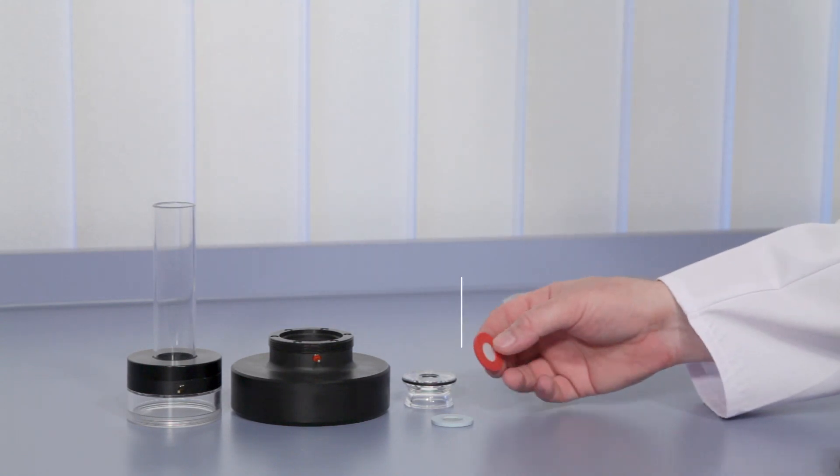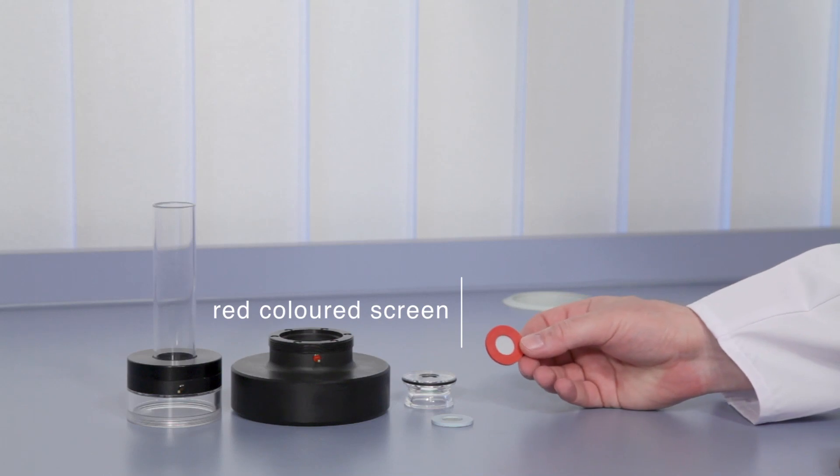If low, consistent and fast draining or fine dispersed fiber samples are to be measured, use the red colored screen with a 40 micron fabric.